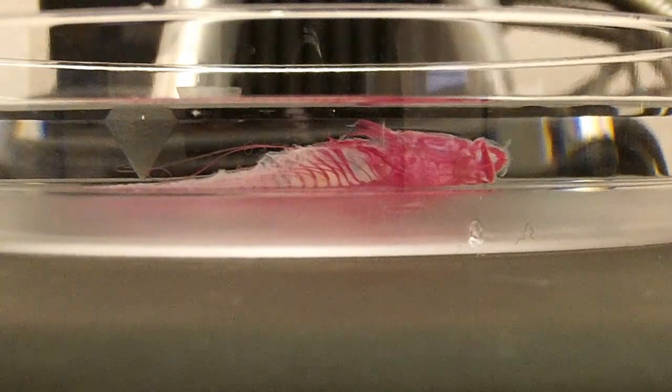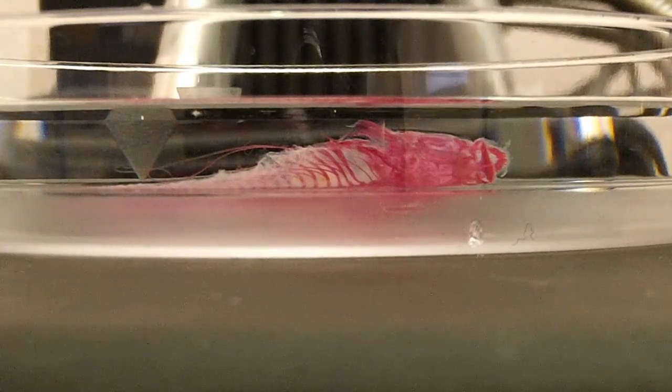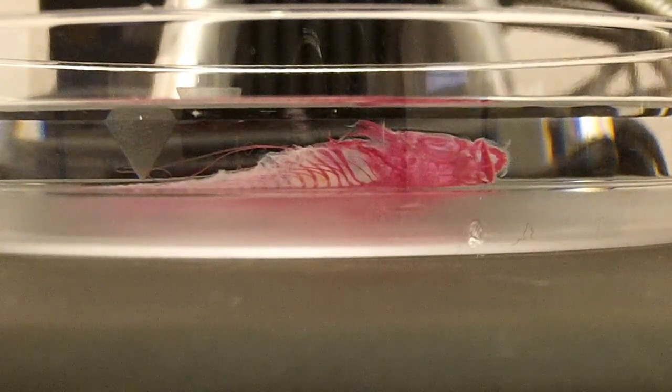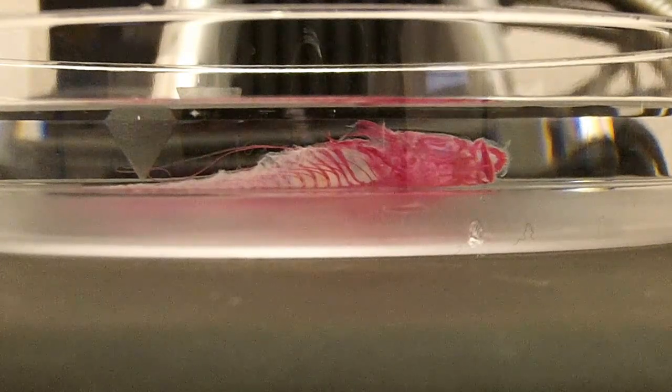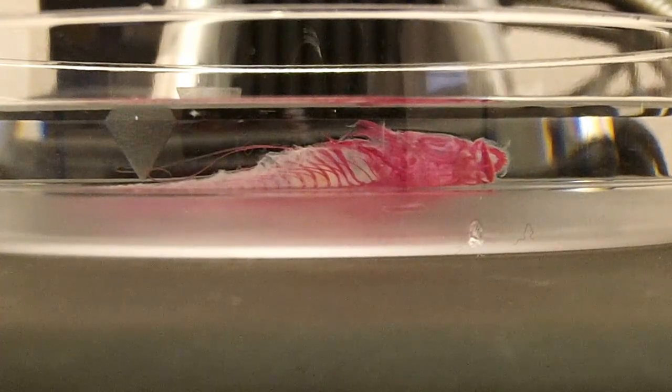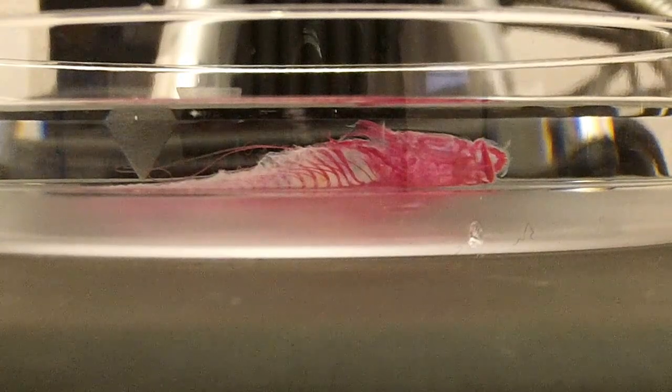I found it was very important to make sure that the specimen was completely covered with water, as can be seen here, because if any part of the specimen either touched the water surface or protruded from it, it would create a distortion in the image that would ruin it.